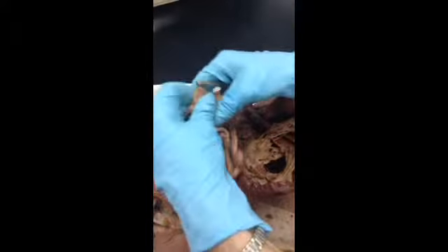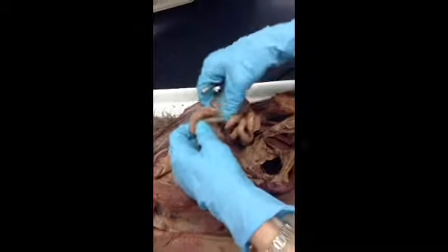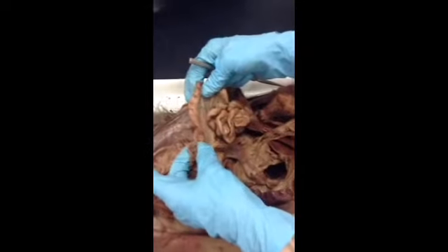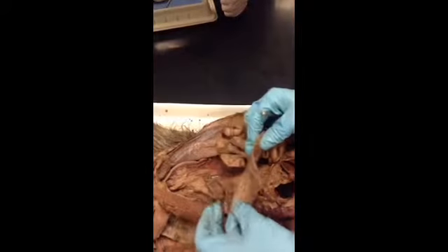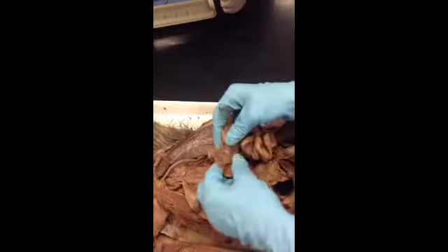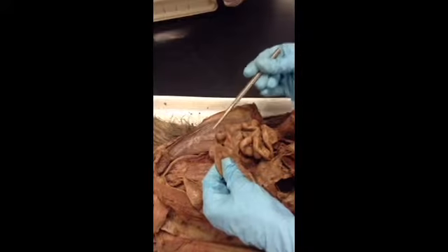Okay, all of this curly stuff, this is jejunum for absorption. And then finally, our last little loop here is ileum. Ileum attaches to the large intestine, which is this. Okay. Right where it attaches, you have this little blind sac. That's the cecum. That's where our appendix would be, hanging down there.